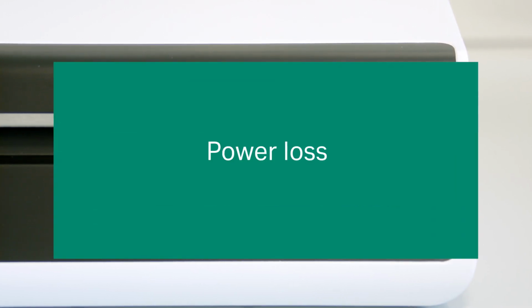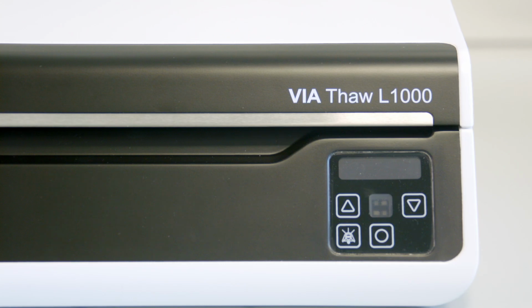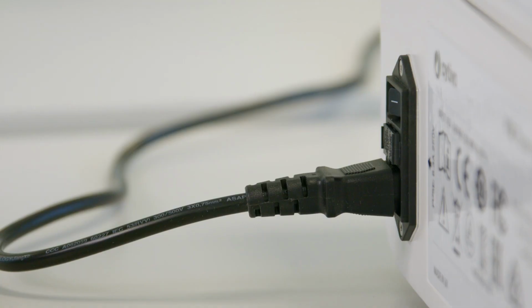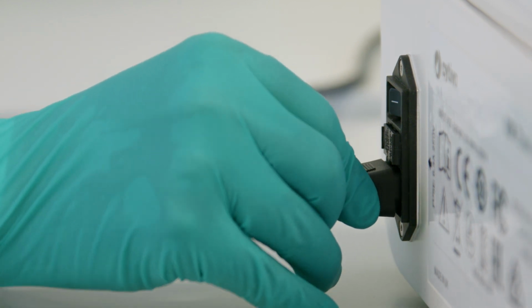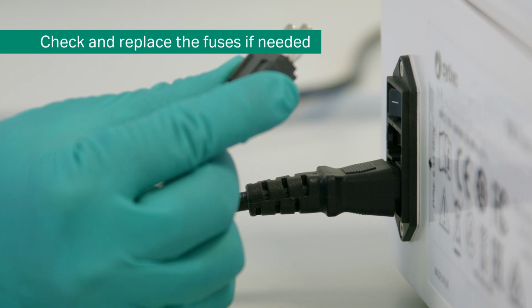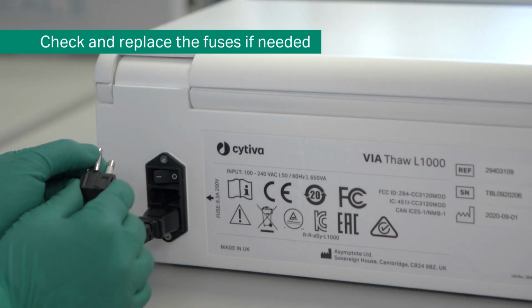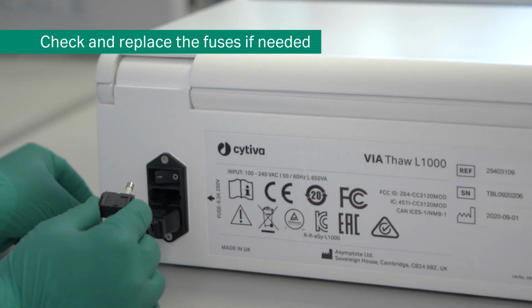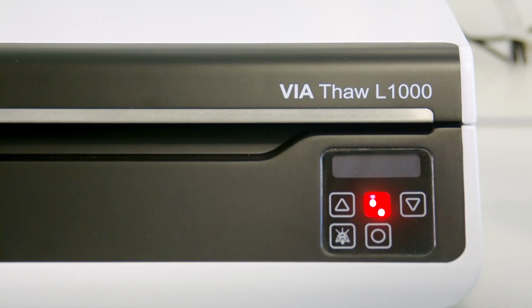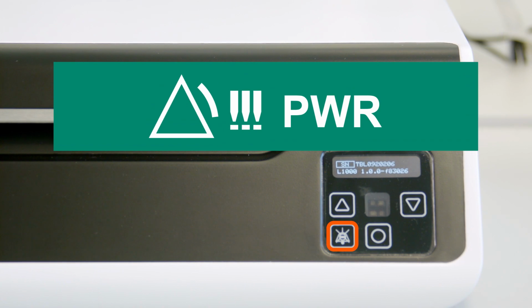If there is a loss of power, the instrument will stop working immediately. To resolve the issue, check that the power cable is securely connected at the back of the instrument. If needed, the fuse is accessible beneath the power switch and can be replaced by pinching the sides of the fuse holder. Once power returns, the instrument shows a power loss error and alarm that the operator needs to acknowledge to clear.